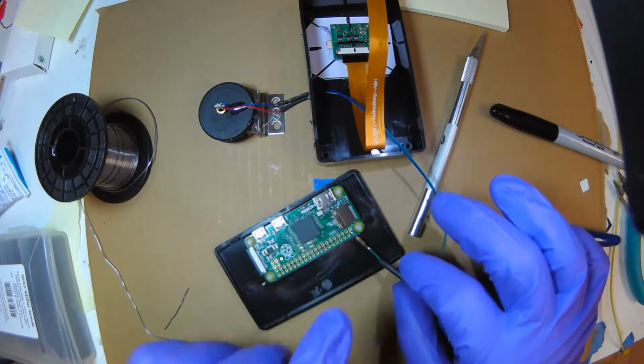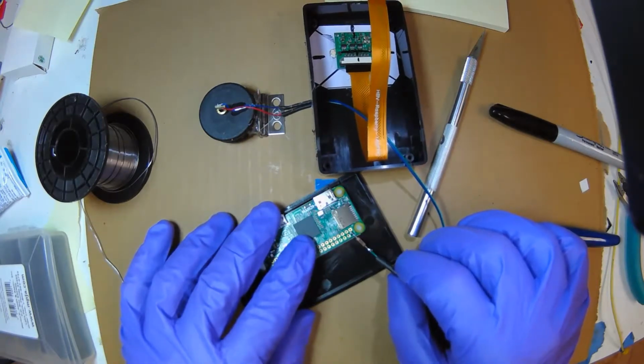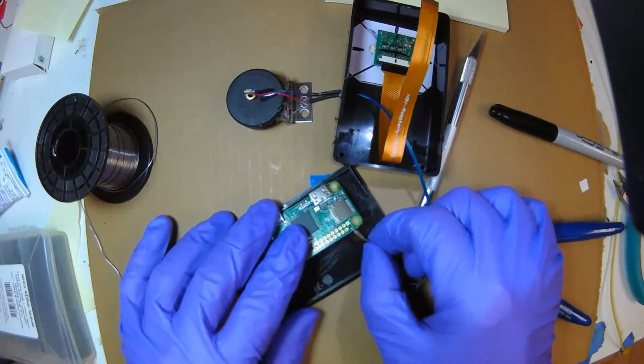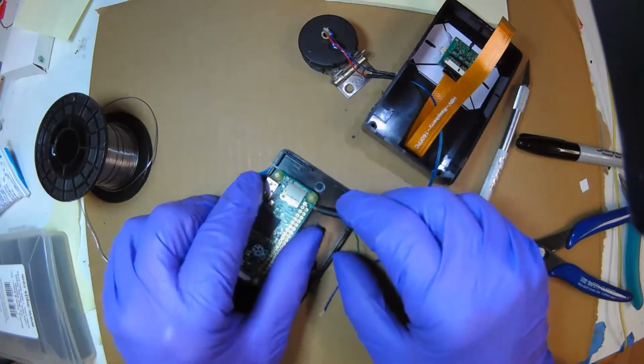Don't put the shrink on it yet, because the shrink will start shrinking due to the hot joint. When it's cold enough, you want to slip it past the joint and onto the resistor. And now slide it over. Ooh, beautiful. There it is.